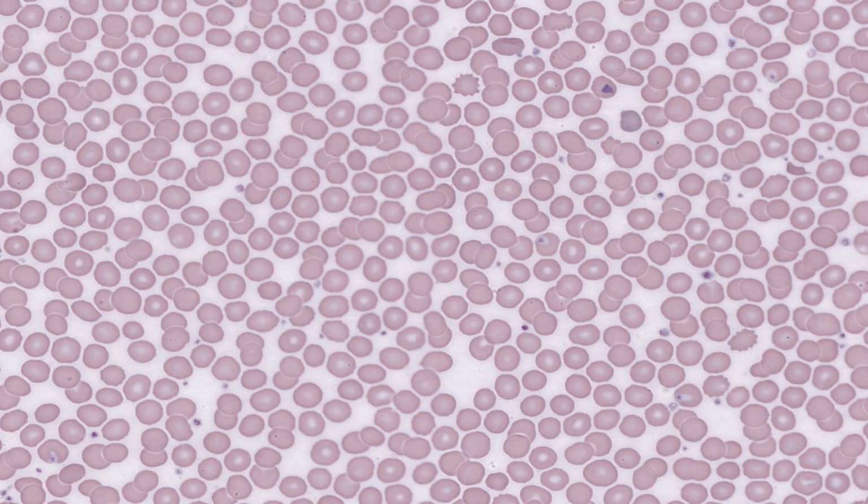In the series of images I'm now going to show you, those of you with a very keen, attentive eye, which is really a must for studying histology, will notice these blurred stained particles. Please remember these, and I'll talk about them at the end of this lecture series.